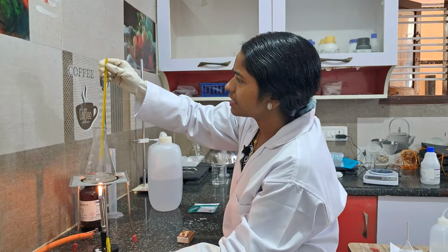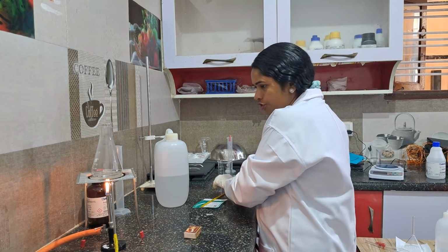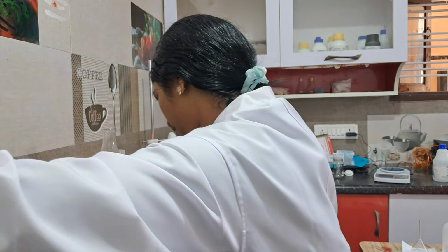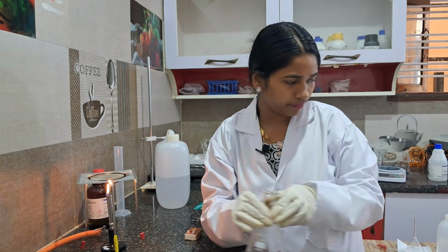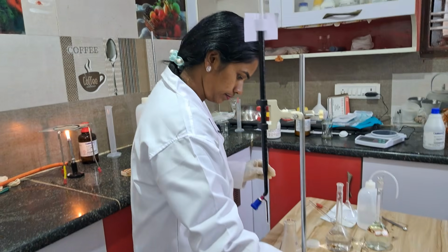Now the temperature is exactly around 63, 64, so I am going to stop it. Okay, let's do the titration. It is exactly at 21.